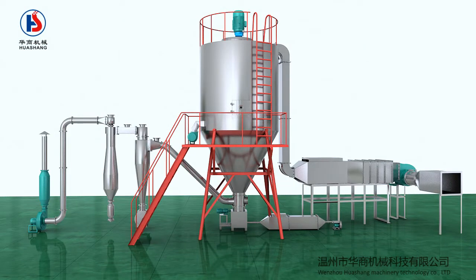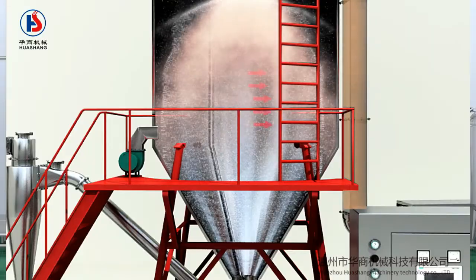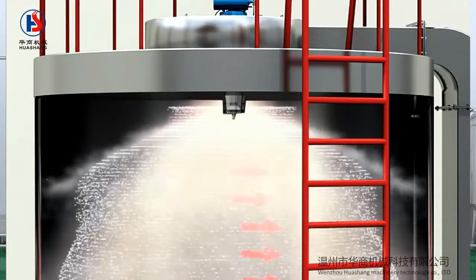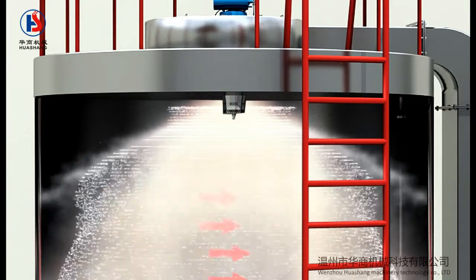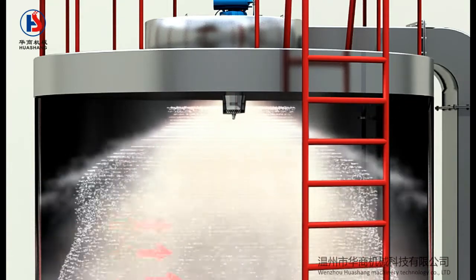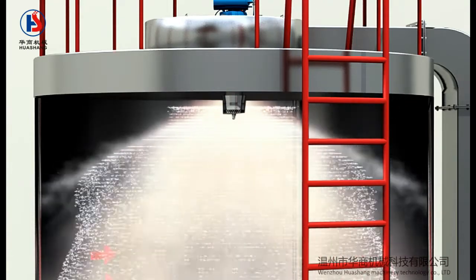Clients can choose different drying modes according to their own needs. If material in powder form is needed, transport the material into a spray dryer. Vacuum drying or belt drying can be carried out as well.